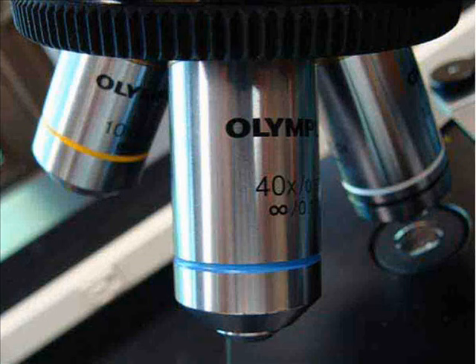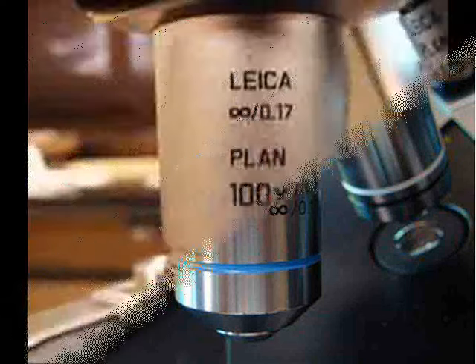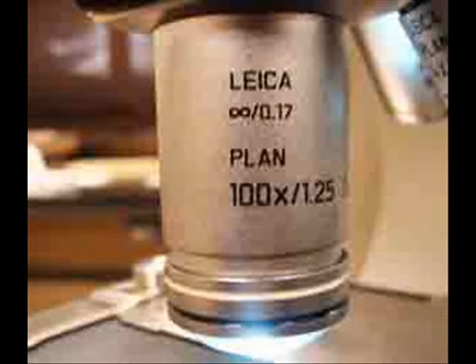Manipulating the coarse focus when using these longer objective lenses will, at the very least, take your specimen out of focus immediately. And worst case scenario, could smash the lens into the slide, damaging the microscope.